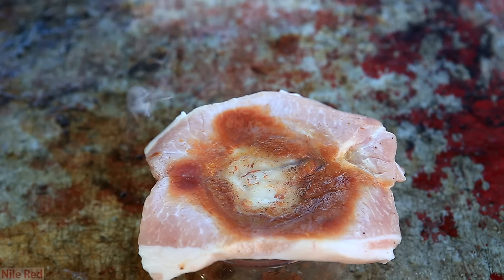I don't show it here, but the underside of the pork, even after a minute, was still uncooked. I don't have any real conclusions to draw from this experiment, but I was honestly surprised because I thought the white phosphorus was going to do a lot more damage.